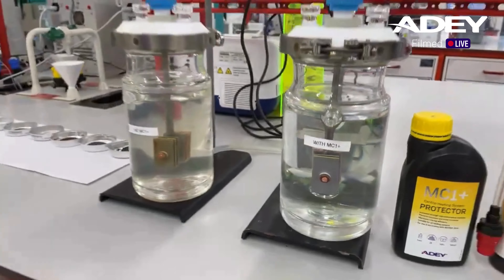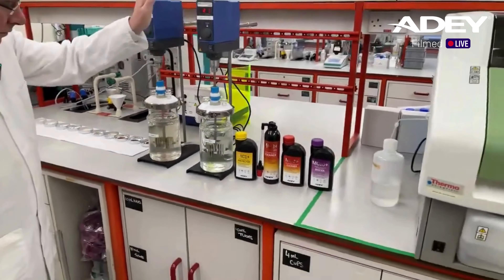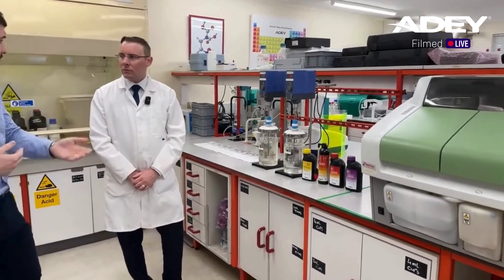These were set up just a couple of hours ago. And as you can see, the one that has not got any MC1 Plus inside has already started to show signs of corrosion, and the fluid itself has started to go tinted with a characteristic iron colour. I would always use inhibitor. BS 7593 states that inhibitors should be tested for annually, and it's something that boiler manufacturers will check for when they're doing a warranty call. So we know it's a really good way of helping prevent this corrosion, as we can clearly see already.